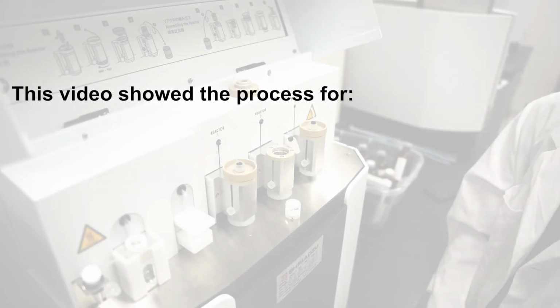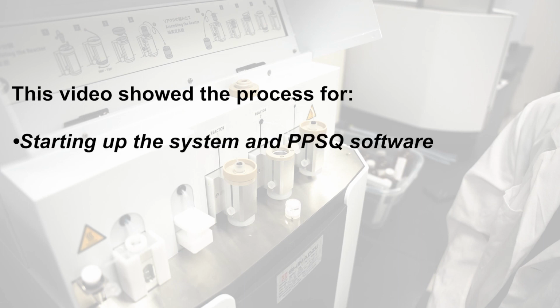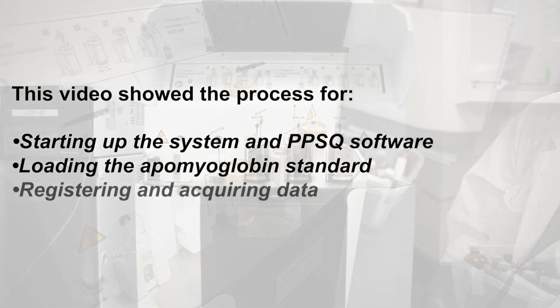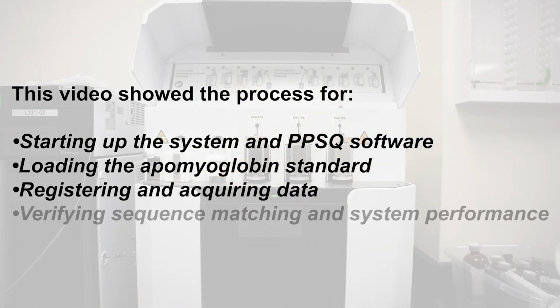We have now gone through the process of starting up the system and PPSQ software, loading your apomyoglobin standard, registering and acquiring your data, and verifying sequence matching and system performance.